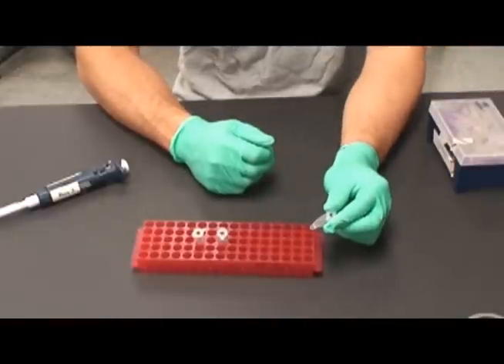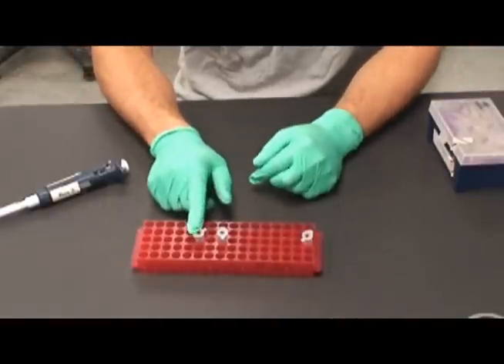Here, we have the plasmid DNA created in Part 1, and the two tubes of competent cells.